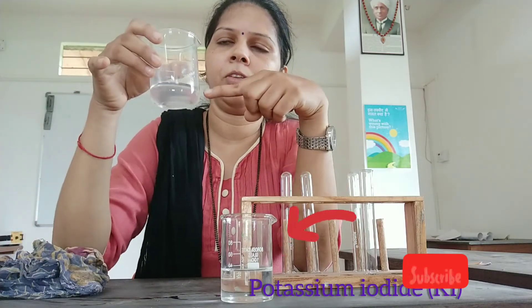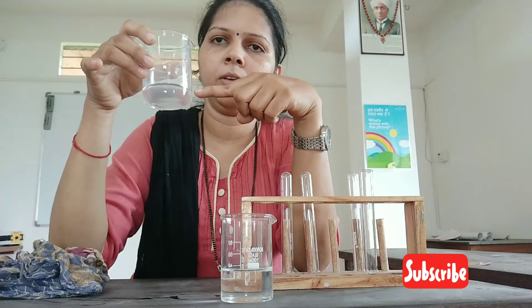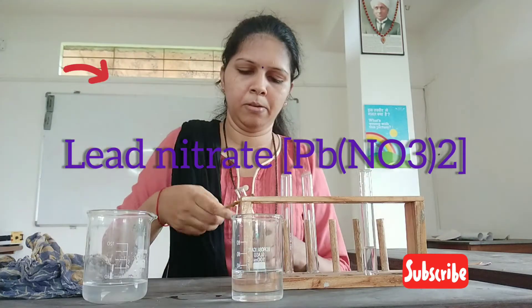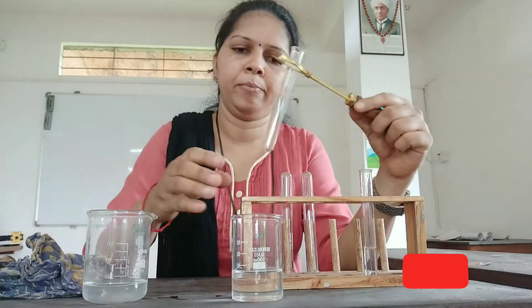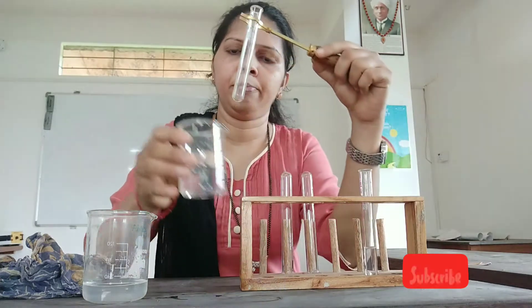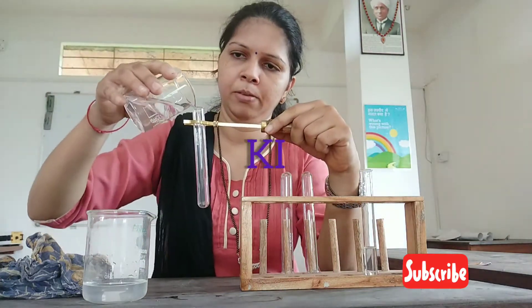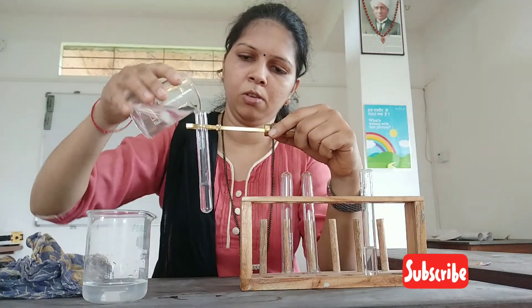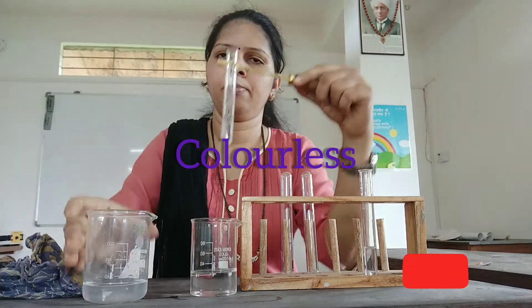Here I have taken potassium iodide solution and lead nitrate solution. Let me add potassium iodide solution to the test tube. What is the color? The solution is colorless.